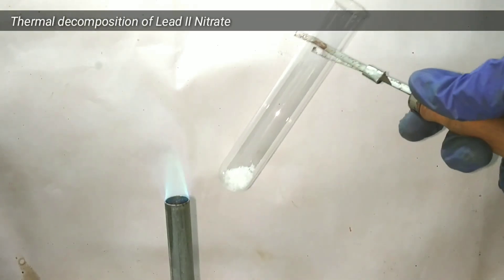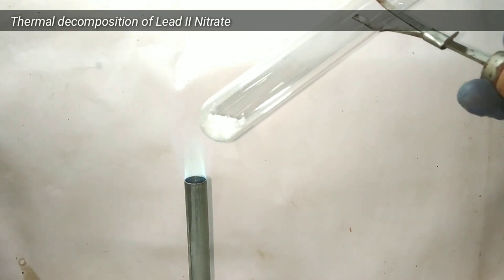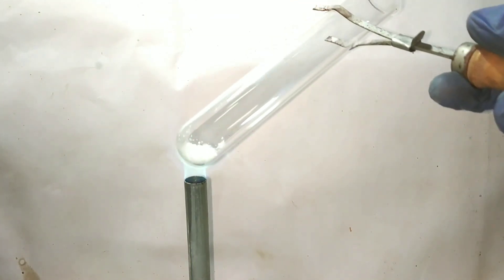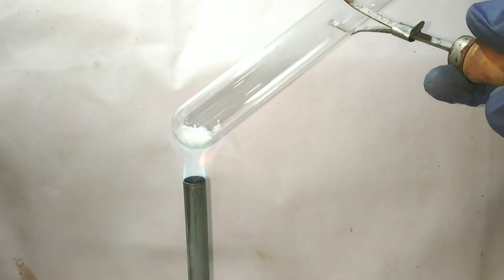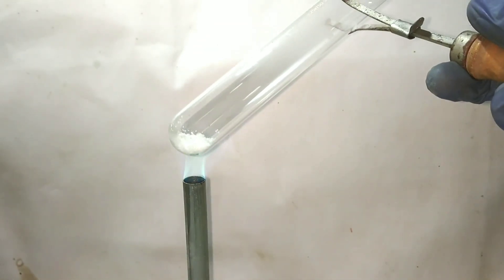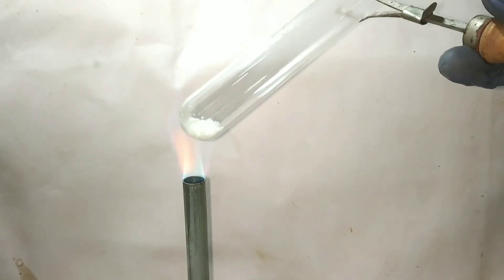Finally, we come to the classic experiment: the thermal decomposition of lead(II) nitrate. I have taken 1 gram of lead(II) nitrate in a test tube and I am heating it on a Bunsen burner flame, holding the test tube in a slanting position.